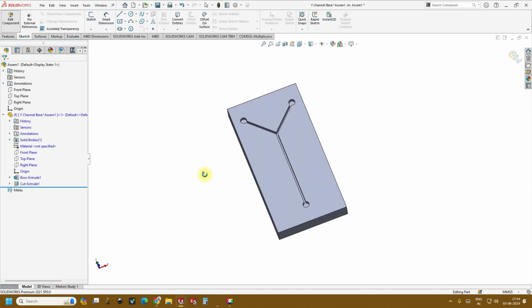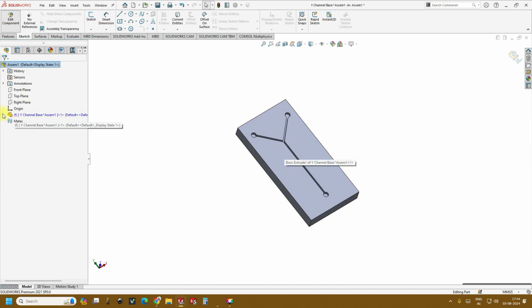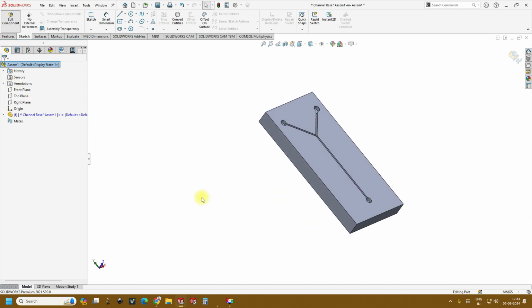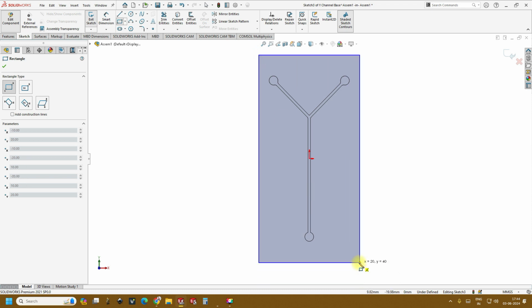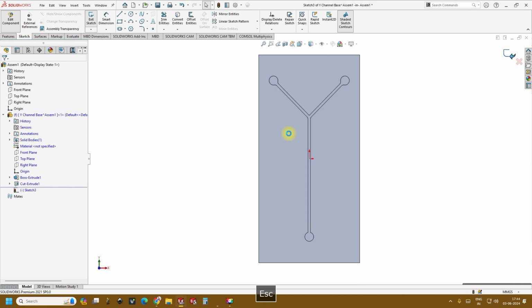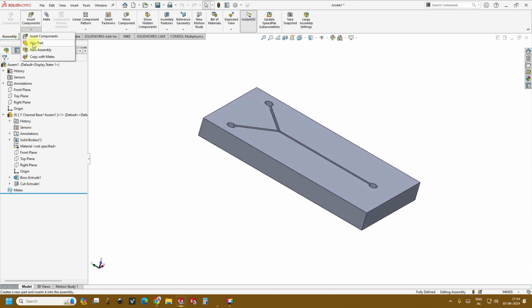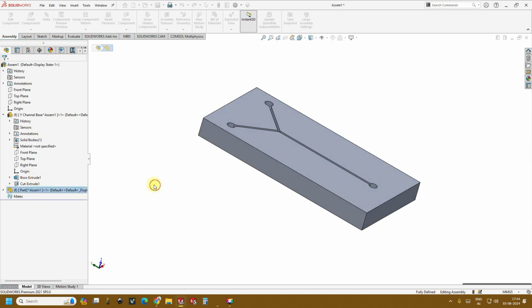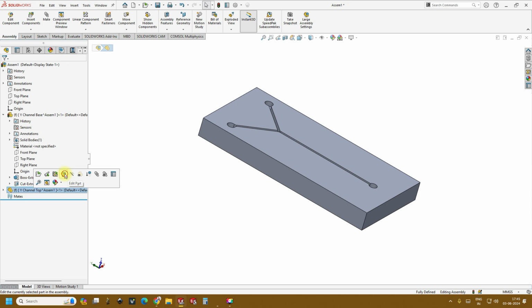In the same way, if you wanted to close this microfluidic channel, then just create one more layer, or instead of this, exit the component completely and go back to assembly and insert a new part, and we can rename this part as Y-Channel top. Okay, just press enter, and then the same thing you have to do, click on it and go to edit part.